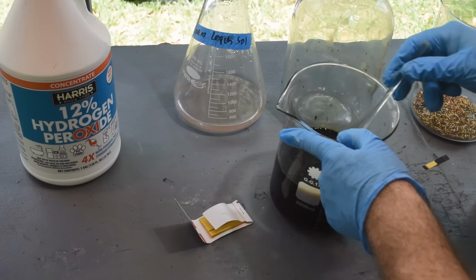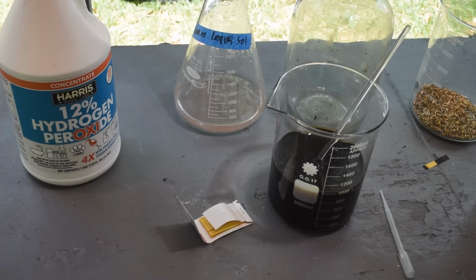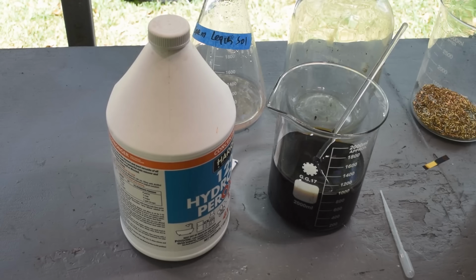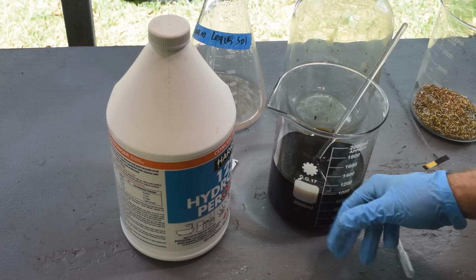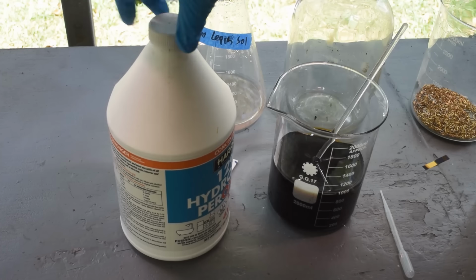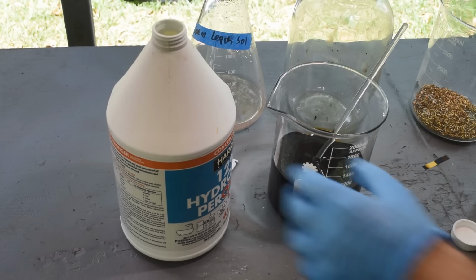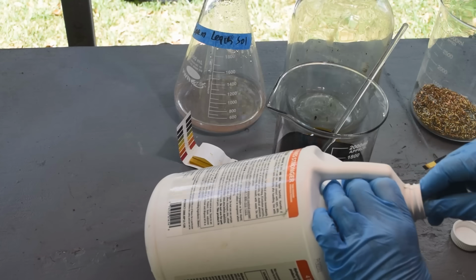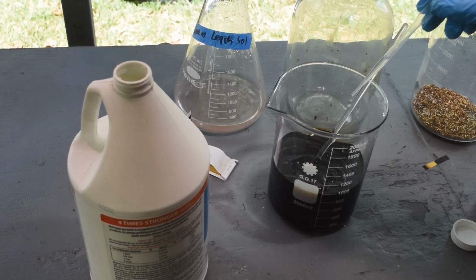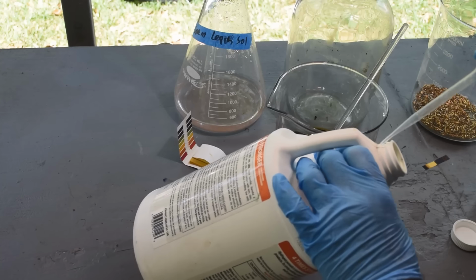What I'm not sure about is how much free iodine we have in here now. I think I'm going to add a few milliliters of hydrogen peroxide to it just to make sure we've got plenty of free iodine. Our pH is where it needs to be, but let's see if we can free up some more iodine. Let me get a clean pipette, and we'll get a little bit of this. See what happens when it goes in. A bit more.